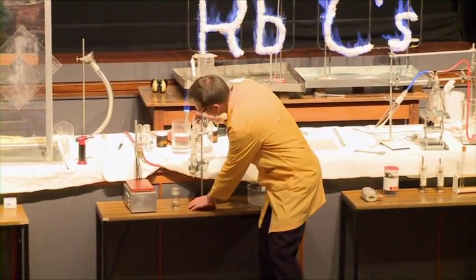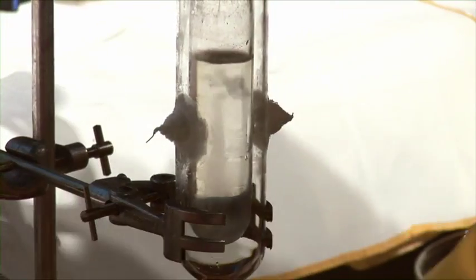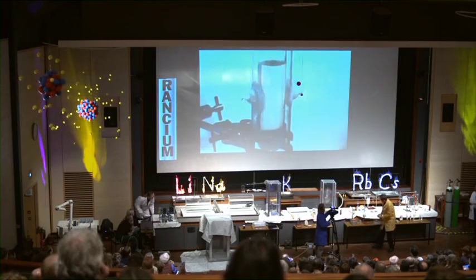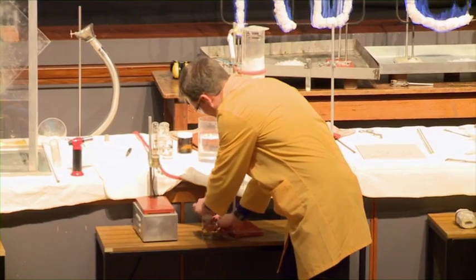It's even possible to almost see some electrons. This is liquid ammonia, and a special piece of apparatus so we can keep the liquid ammonia from boiling off. And I'm going to add some sodium to this.